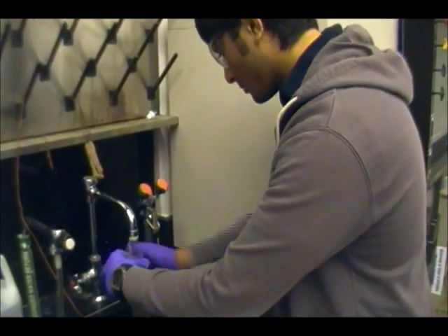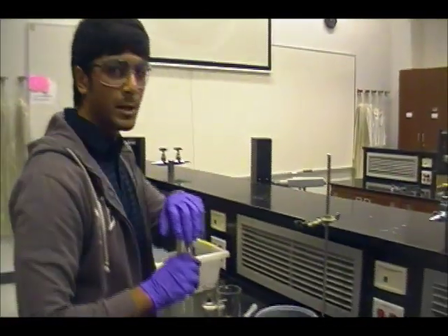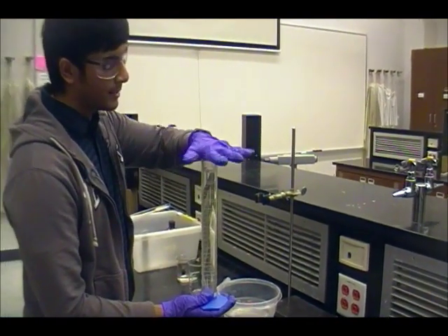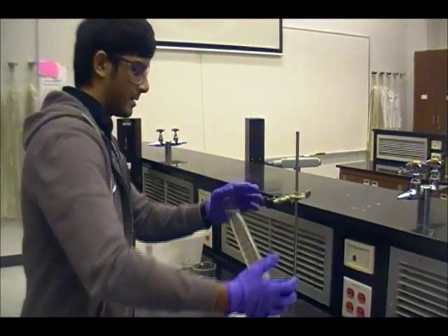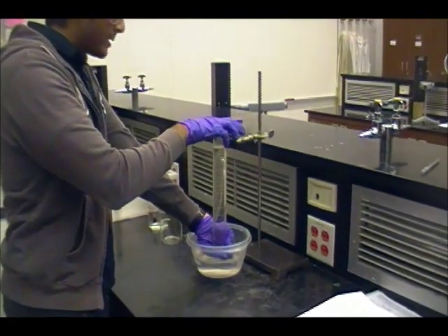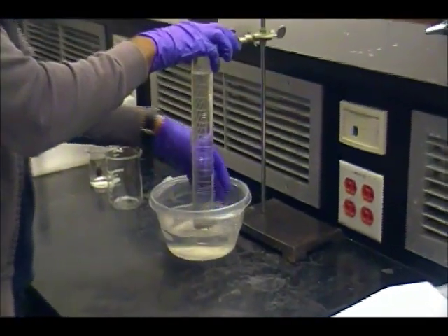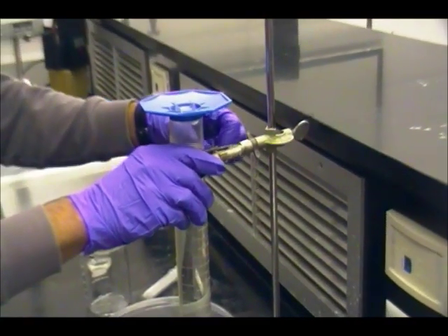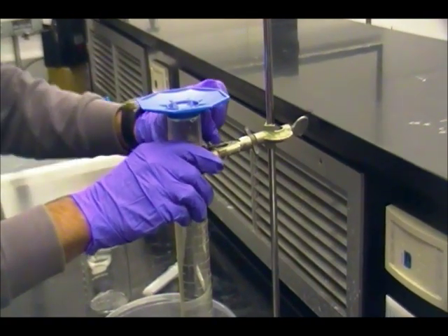We fill it up all the way because when we invert the graduated cylinder for this experiment, water will probably be lost to the container. So when we invert it, put your hand on top of it, and we're going to do that really slowly, and then put your hand underneath, submerge your hand under the water, and then release the graduated cylinder. This is just to make sure you don't have to hold it the whole time. If you want to hold it the whole time, then you don't even need the ring stand and the clamp.